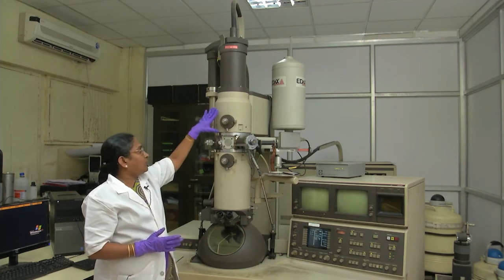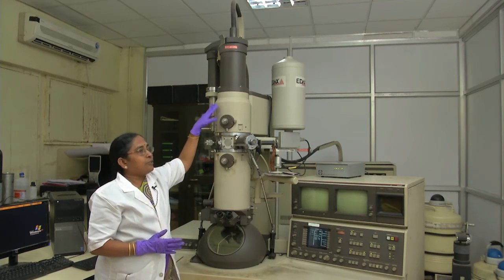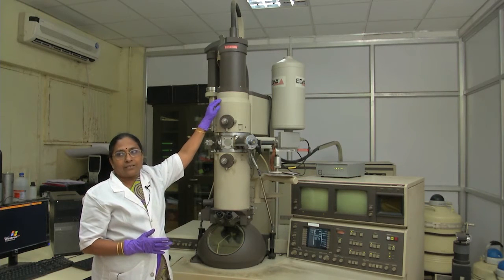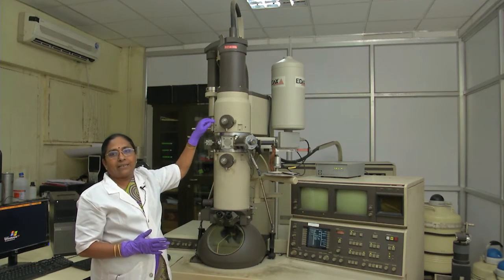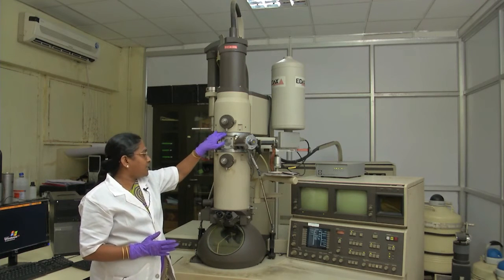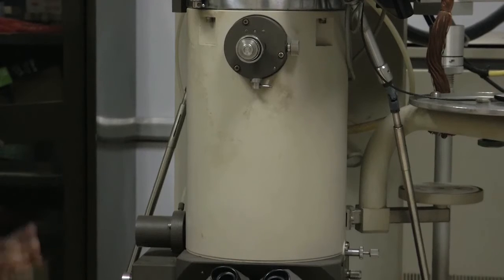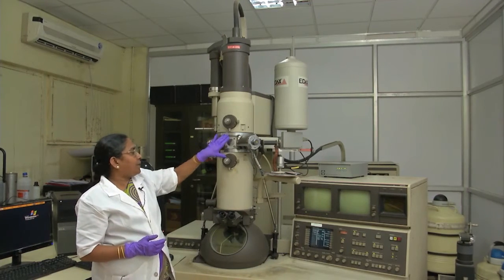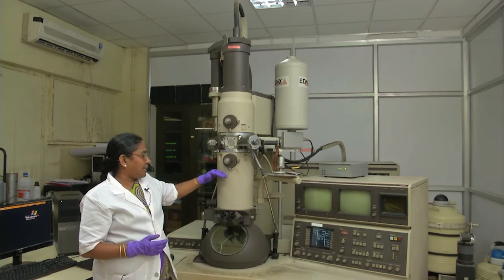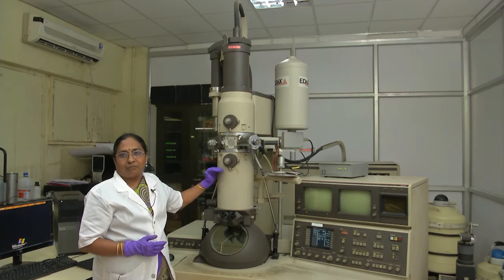In this CM12 transmission electron microscope, they have introduced 4 illumination lenses: condenser 1, condenser 2, mini condenser, and condenser objective lens. From there, all image formation and magnification lenses are present — an objective lens, then intermediate lens and diffraction lens. These 3 lenses form the image as well as the diffraction.